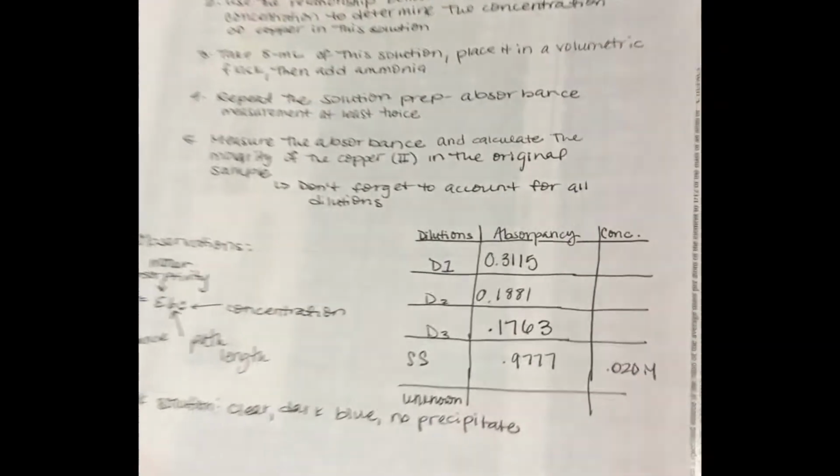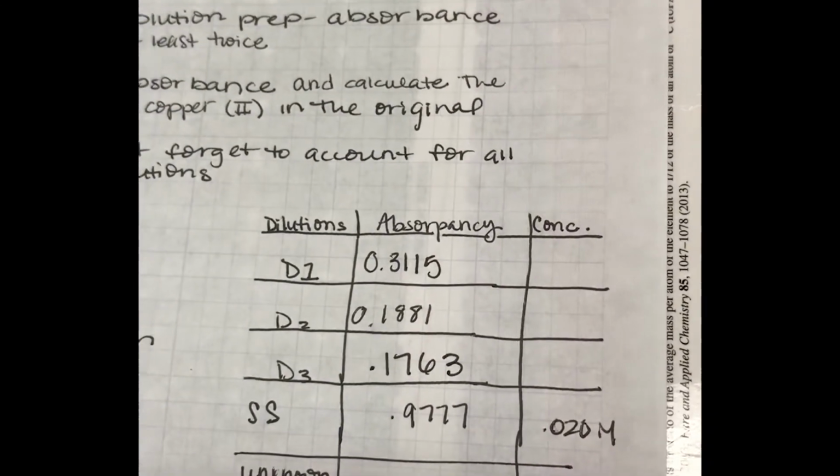We can use that one big thing. I don't know, you told me. Always. I remember in the video it said first. So what's your first step before you use... I don't think we... no wait, they use the scan here.